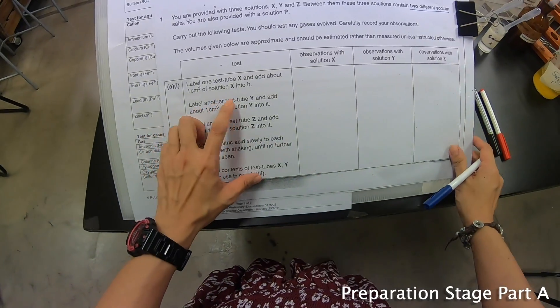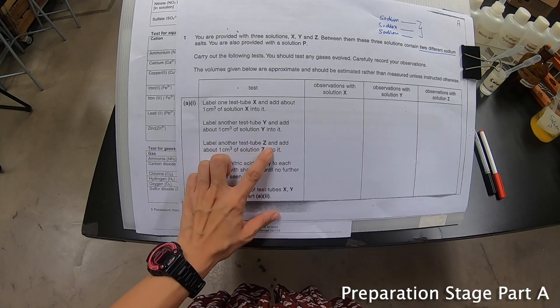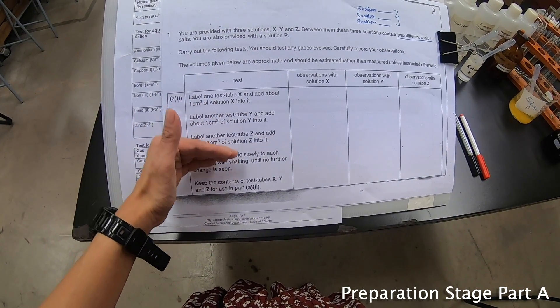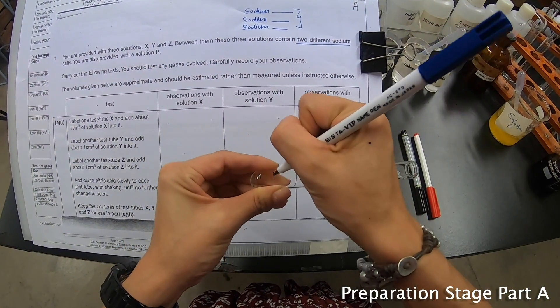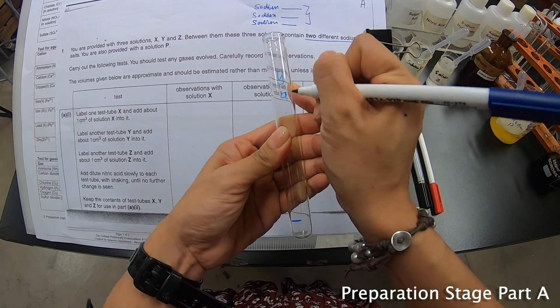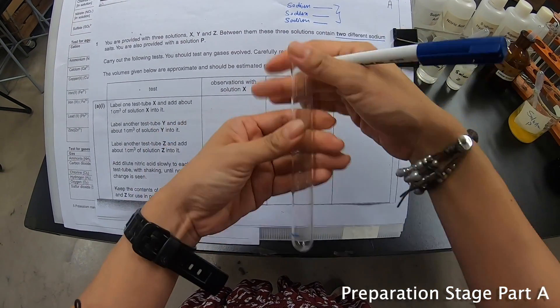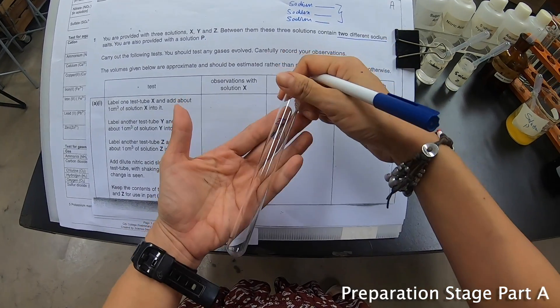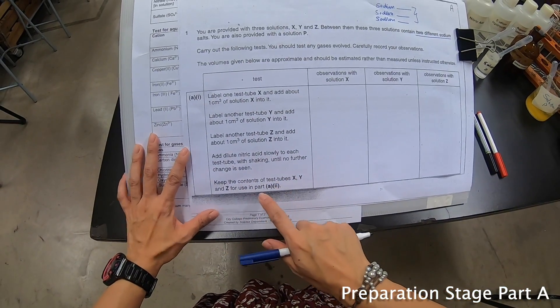Label another test tube Y and add about 1 cm³ of solution Y into it. Label another test tube Z and add about 1 cm³ of solution Z into it. So X, Y, and Z — I'm going to repeat all of those steps. Keep the contents of test tubes X, Y, and Z for use in Part A, part 2.